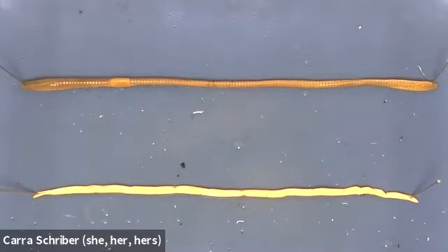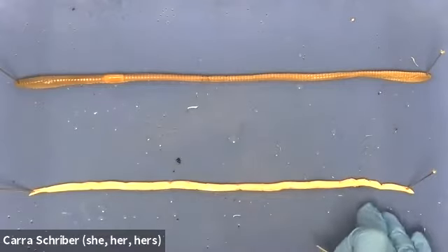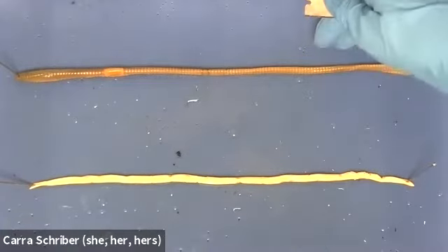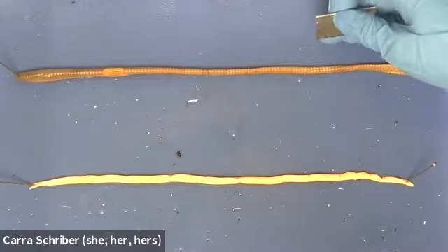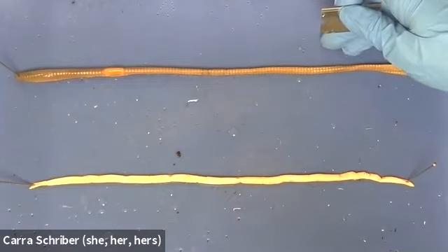What I want to do is look at the internal components, so in order to do that, we're going to perform a dissection, right? Dissecting these 2 different organisms is really quite different, even though they look very similar. The pseudocoelomate, this roundworm, is actually going to be more like a sac of organs, right? And the earthworm is segmented, and it's a coelomate, and it has a lot more complexity. What that means for me as the dissector is that I'm going to have a lot more to negotiate here.